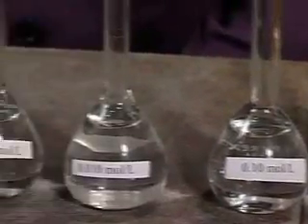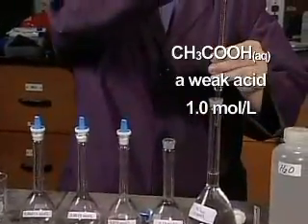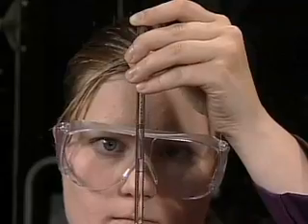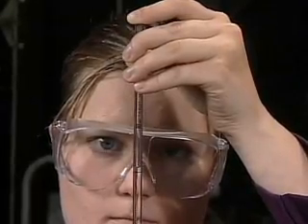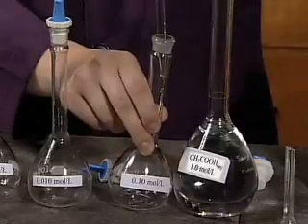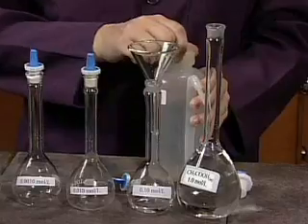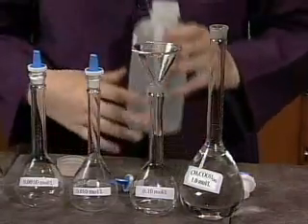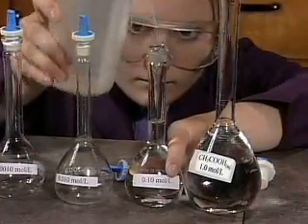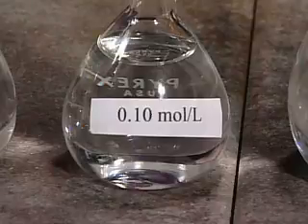These solutions can now be used in biological tests. Biologists are also interested in the effects of weak acids. The third demonstration is the serial dilution of 1.0 mole per liter ethanoic acid, a weak acid. 10.0 milliliters of 1.0 mole per liter ethanoic acid are transferred to a volumetric flask using a volumetric pipette. Deionized water is added from a wash bottle to fill the flask exactly to the 100 milliliter calibration line. The concentration of the weak ethanoic acid solution is now 0.10 mole per liter.